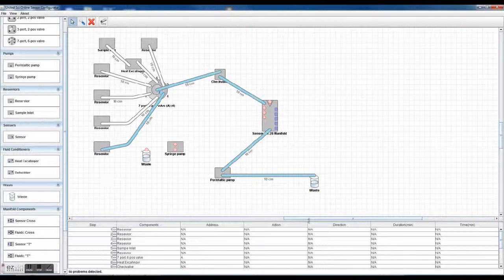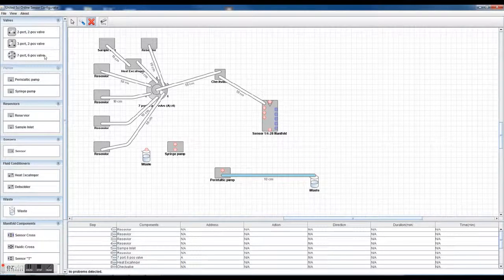Suppose you wanted to have a syringe pump here that injects a milliliter of colorimetric reagent in there, so that maybe you test it right here. Well, then you need to have a different component in the bottom here. So here I'm going to break that component here, and put a 3-port 2-position valve. And of course, it has another unique address to it, and you can address each of these components here on the fluidic program.